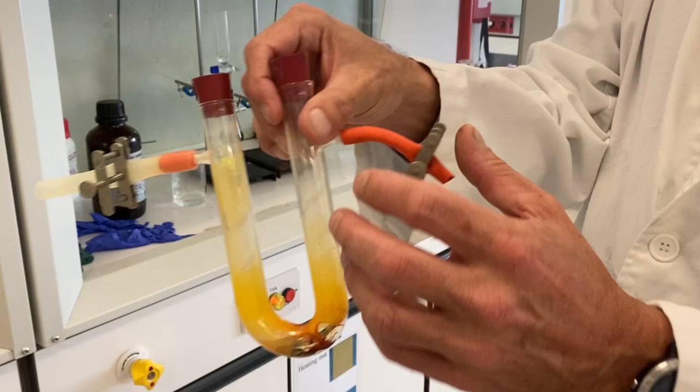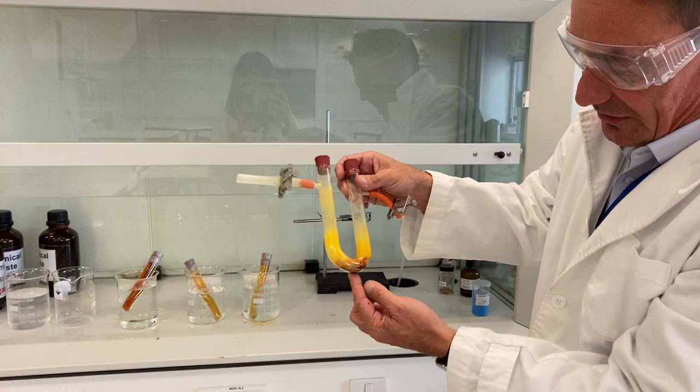Right, hello, here we are, back again. I've taken the tube out now, I've sealed off all the ends, look, so we're quite safe, says he, hope so.